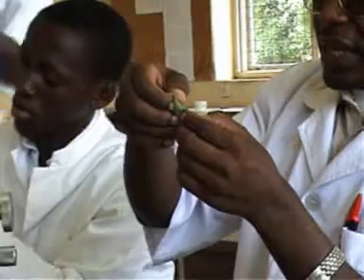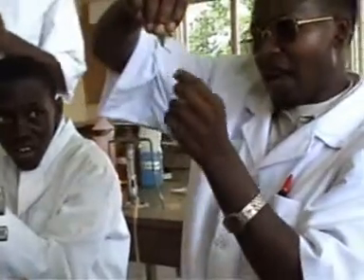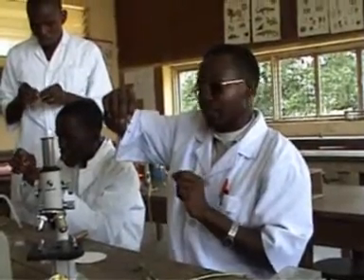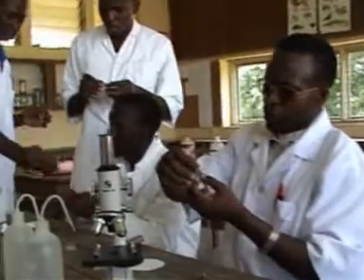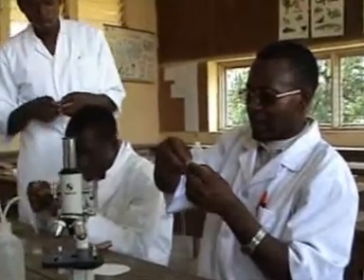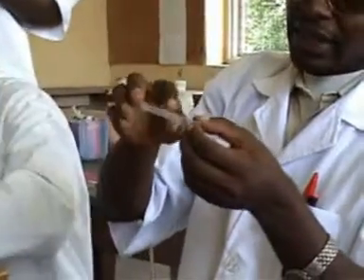When you tear it, you come up with a very thin layer, which is almost transparent. You can see that I've broken it and I have a very small layer here which is almost transparent. This is what I am going to use to make a slide, and then I will observe it. So when I break it now and I have this thin layer, I carefully cut off this thin layer with my hand. I cut it off, and then I put it on the empty glass slide.